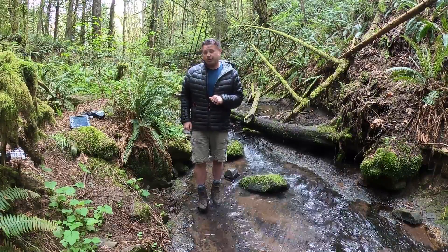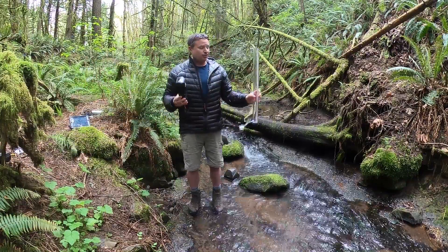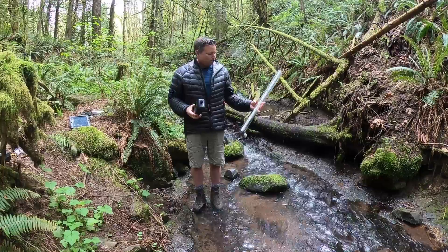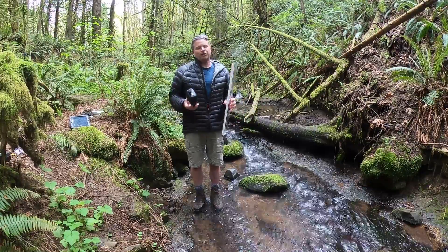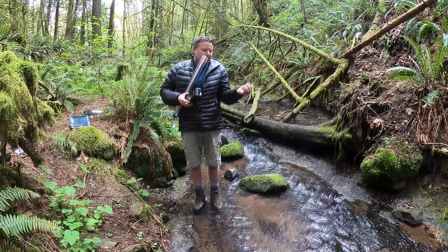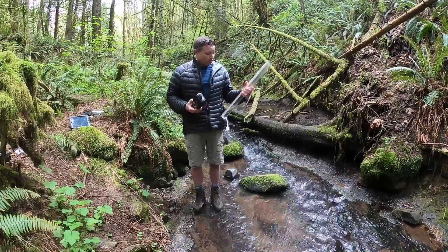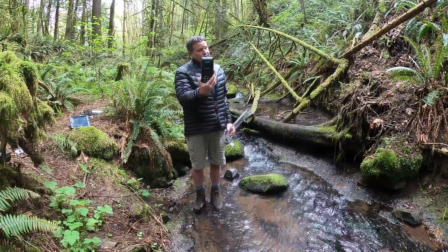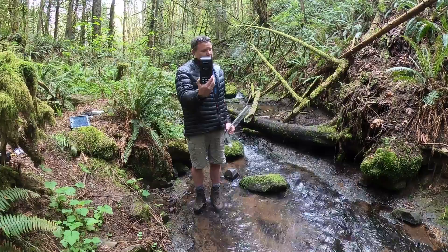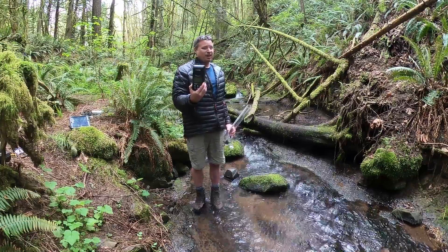The first one we're going to do is turbidity. I'd like to start with turbidity because when I get into the stream I can mess it up and muck it up just a little bit. Turbidity is a measure of how much suspended material — the small, fine particles that don't sink to the bottom — stay in the water as it moves down through the stream. There are electronic devices that are very accurate; this is a turbidity meter, but it's kind of expensive, takes a lot of calibration, and doesn't tolerate a lot of abuse.